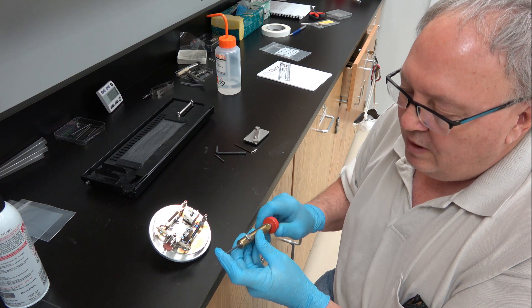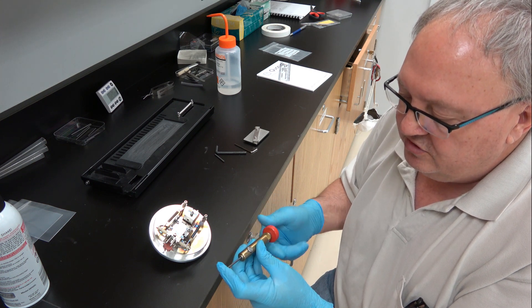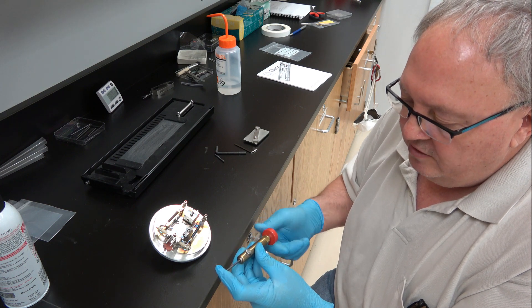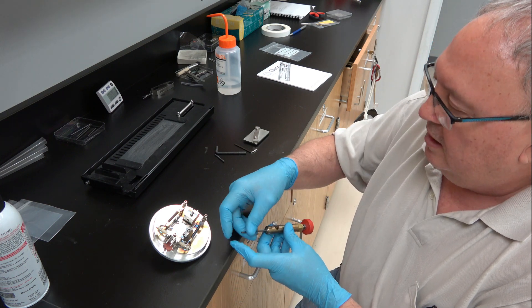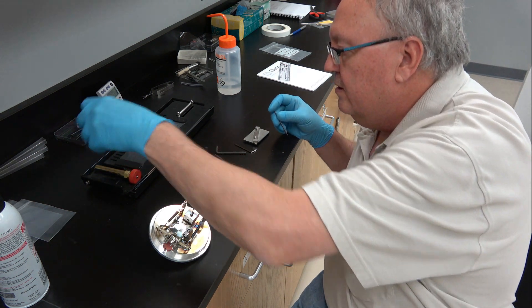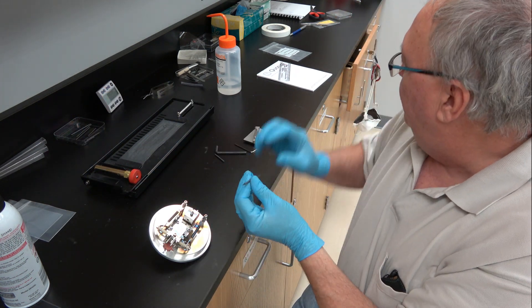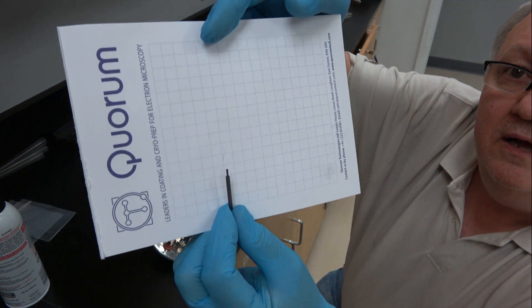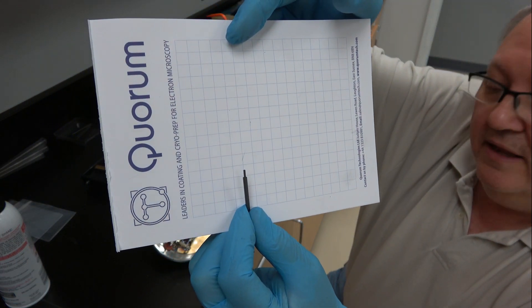The overall rod diameter that you get with the system typically is 3 millimeters, so this shaves it down quite a lot. And then we have this real tiny little spigot on the end.